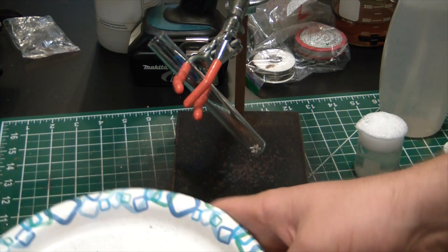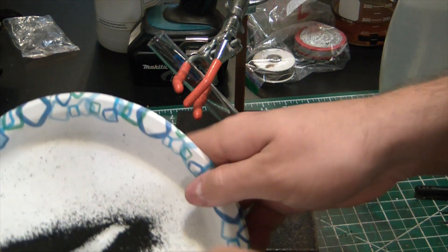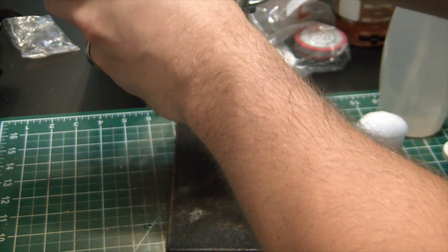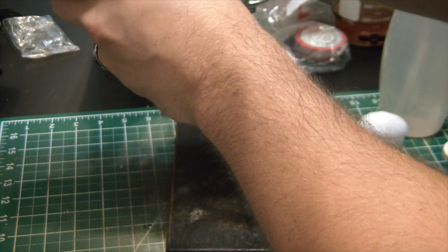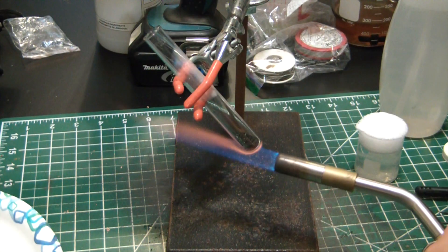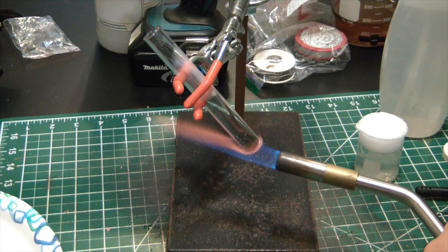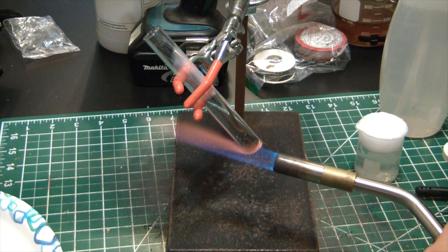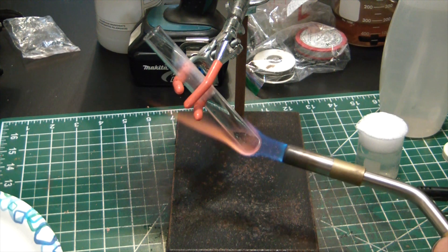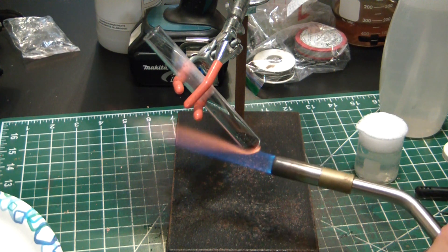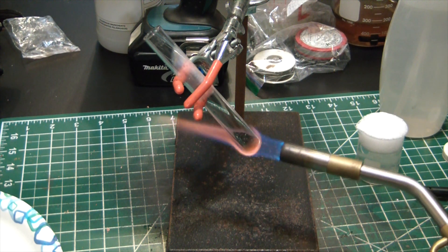Well, the first time was too easy, so I'm going to give that another shot and make a second little batch here. It'd probably be better to do this with some actual calcium turnings.